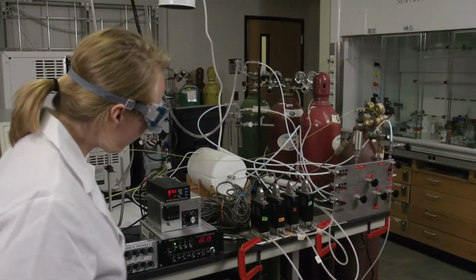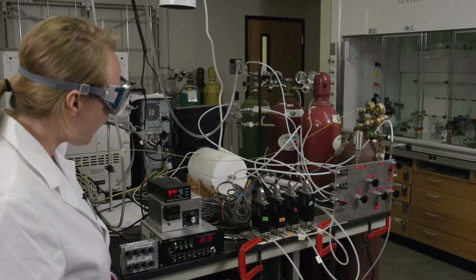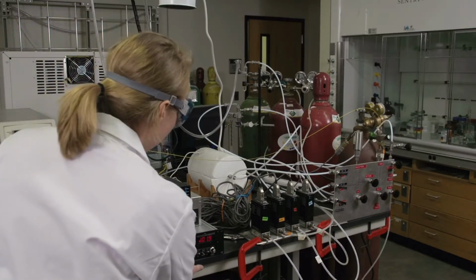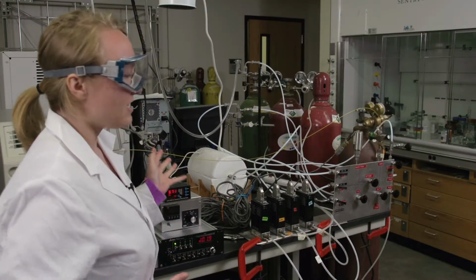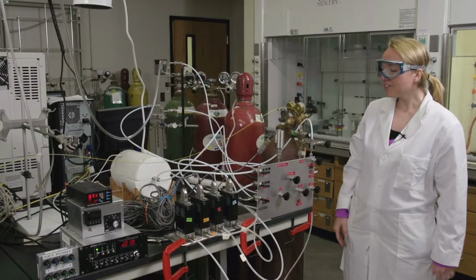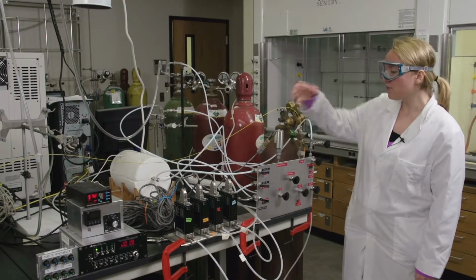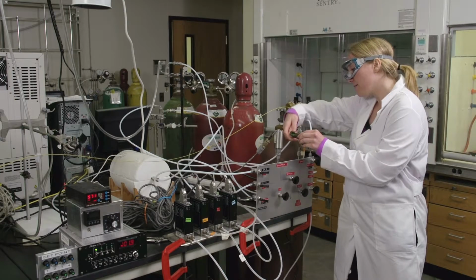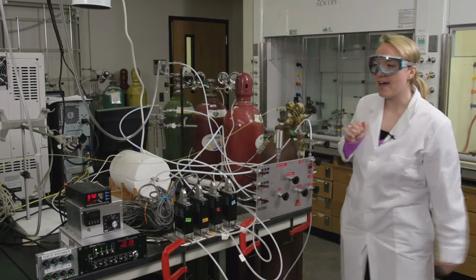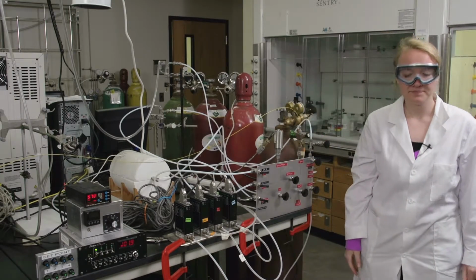When your argon purge is complete, you can go ahead and turn that gas off too by changing the set point back to 0 and then turning that gas off like I just demonstrated. So after you've saved your argon purge data, you'll need to close the green capillary line that leads to the mass spec and then turn off the mass spec.